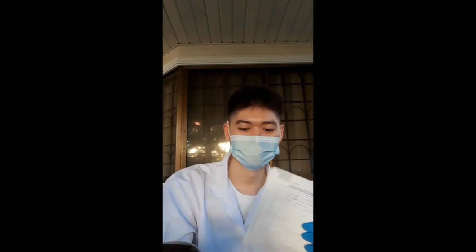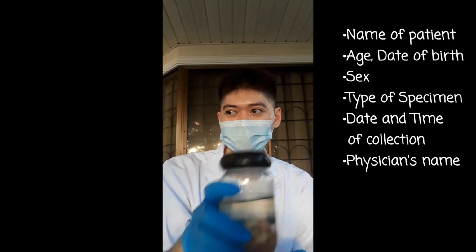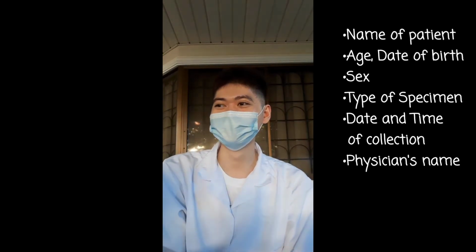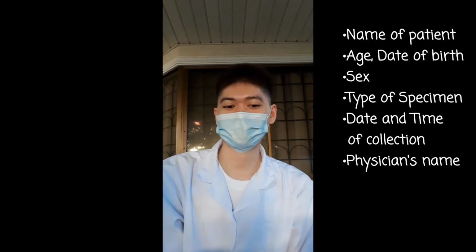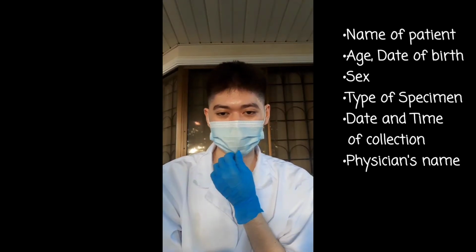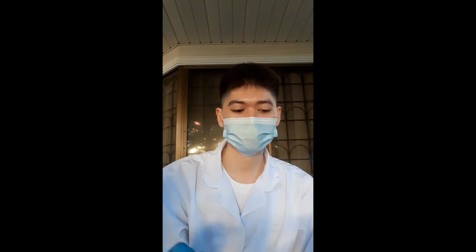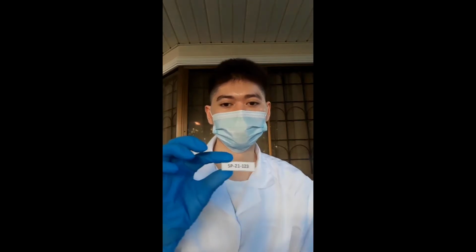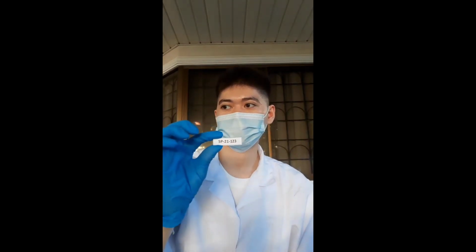So the request form and the specimen container contain some information like the name of the patient, the age, date of birth and sex, the date and time of collection, the type of specimen, and other necessary information that is needed. And after we check that the information given on the request form matches the information that is also indicated in the specimen container, we will then make a specimen accessioning serial number that we will put on the specimen container. And this is how the serial number looks like.